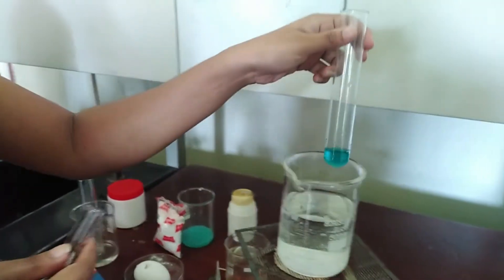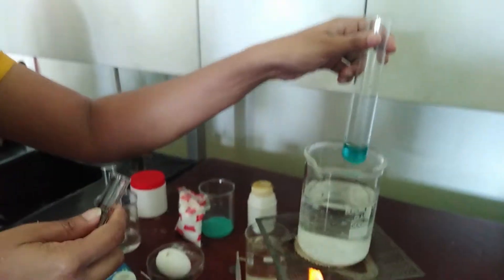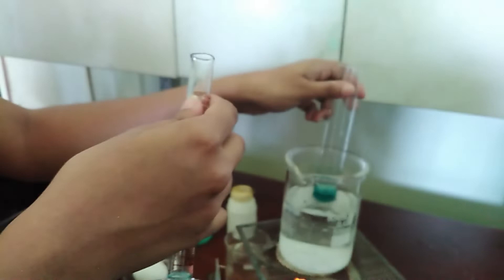Normally benedict solution is blue in color. So initially the mixture is also blue in color.